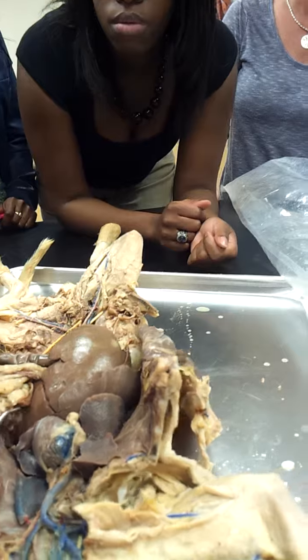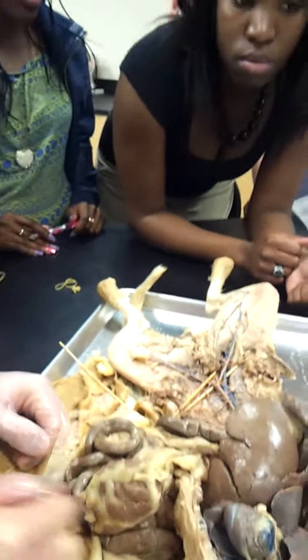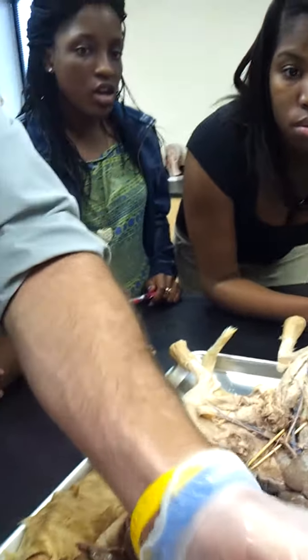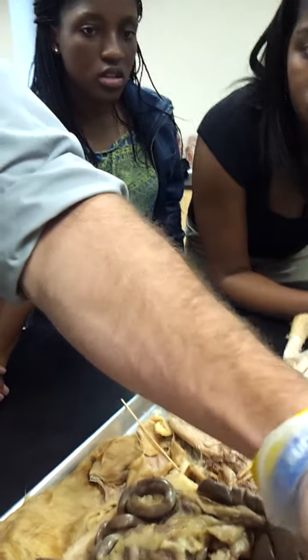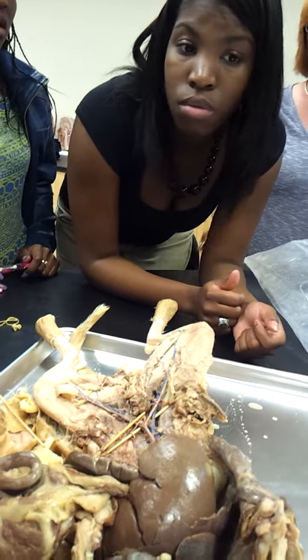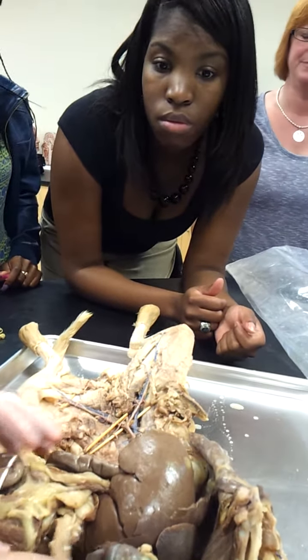That covers that. How can you tell the radial, thumb side, and all that from the cat? Radial is red. You've never seen a cat's thumb? No, I don't do cats. Right here. You got a nice little thumb right there. We don't do cats. Okay. Don't touch it. No. Okay.